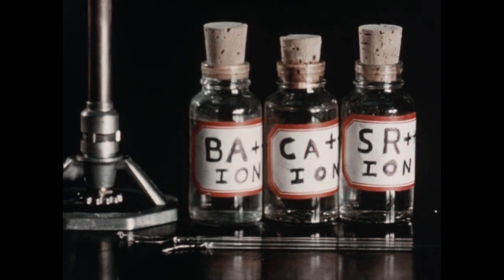We will now demonstrate the different colored flames that barium, calcium, and strontium ions give when solutions containing them are placed on platinum wires and held in the flame of the Bunsen burner. The lights have now been turned out so that we can see the characteristic colors of the flames due to each ion. First, we will test a solution containing the barium ion. You should notice the greenish-yellow flame imparted to the Bunsen burner flame by the barium ion.